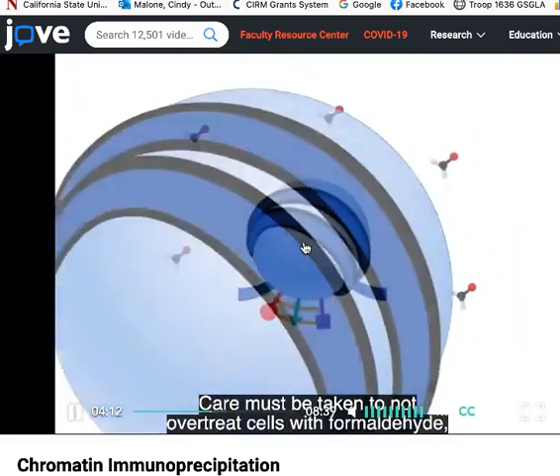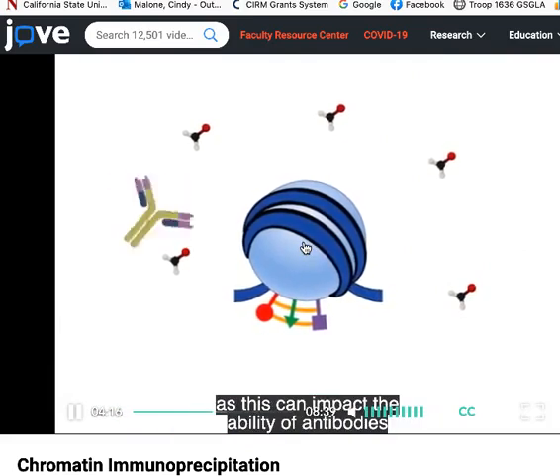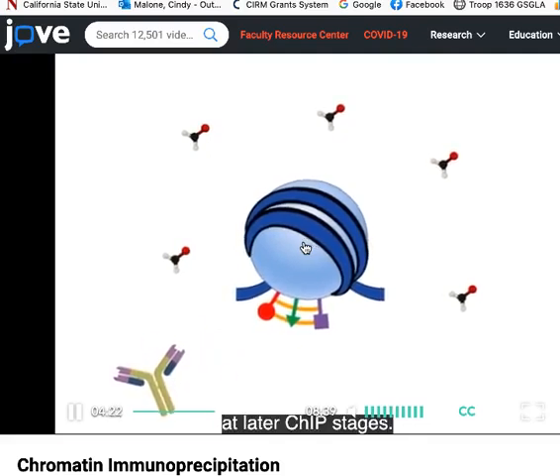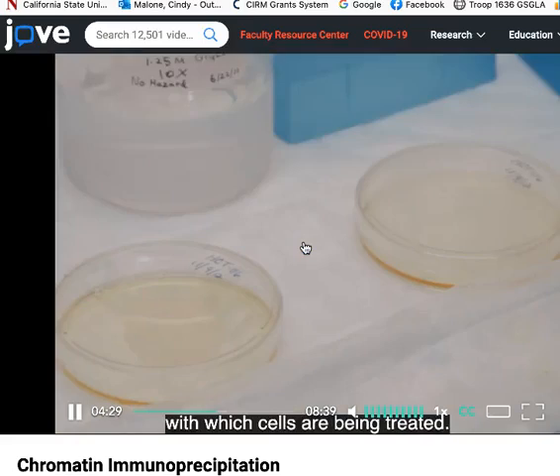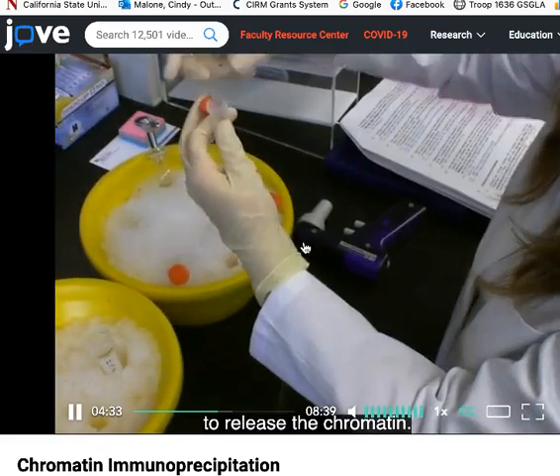Care must be taken to not over-treat cells with formaldehyde, as this can impact the ability of antibodies to recognize their target histone modifications at later ChIP stages. To stop the cross-linking process, glycine is added to the formaldehyde solution with which cells are being treated. The cells are then collected and lysed to release the chromatin.